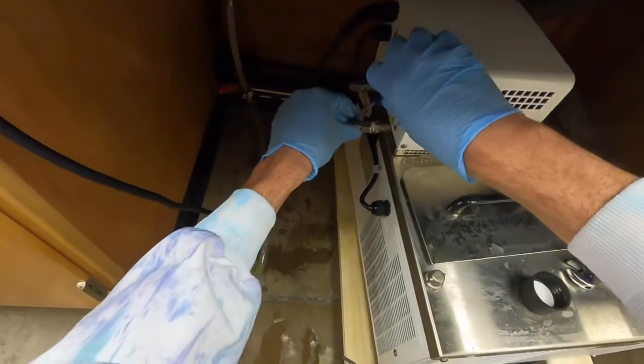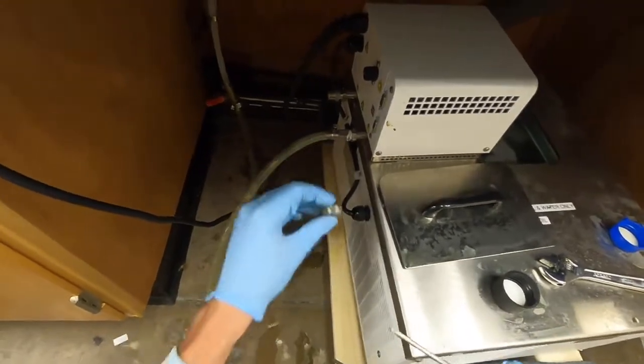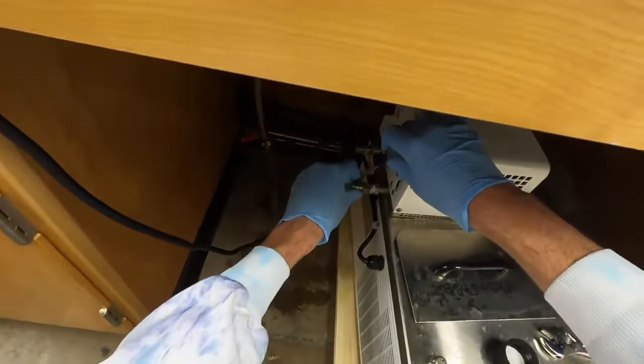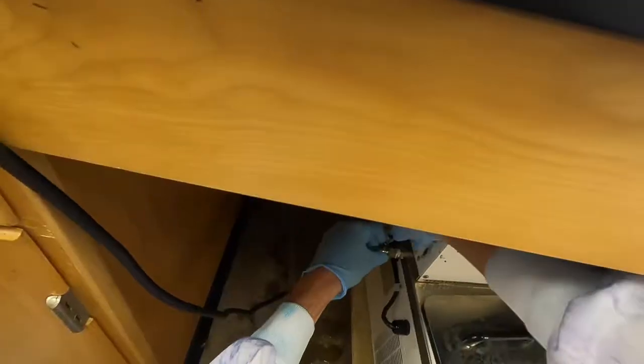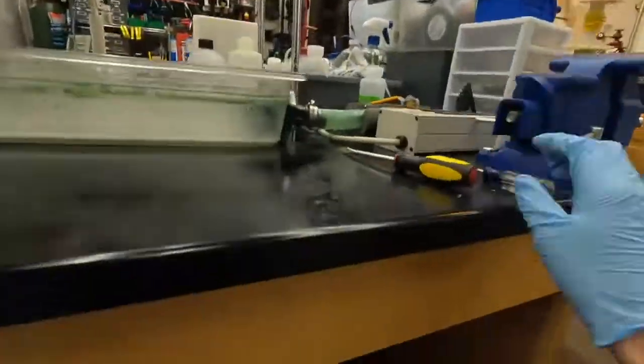I know last summer there was a metal cap, so instead of replacing the tube they just put this metal cap on here to store it. I'm not sure it matters either way. I like to do this so the next time you use it, it's just ready to go. Once that's tight, you double-check that both these valves are closed and then you should be good to go.